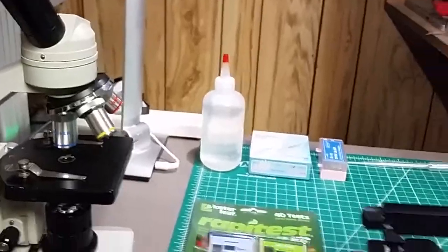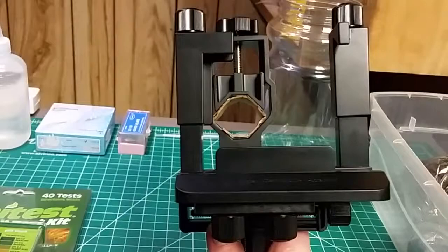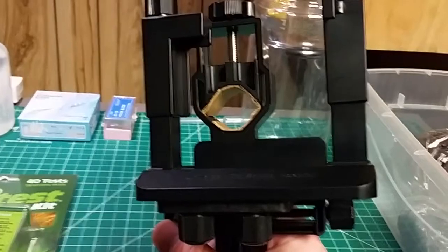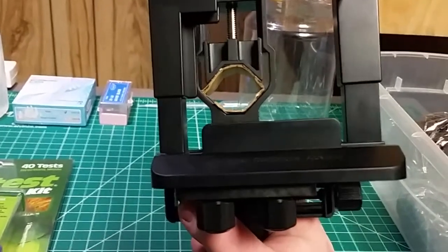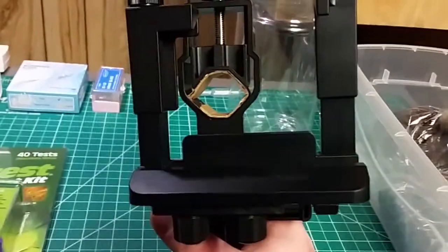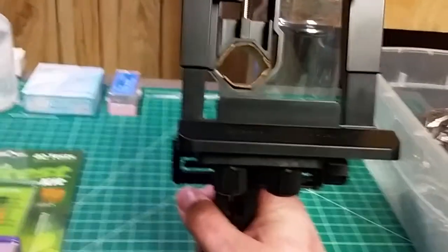As far as the camera mount, this is an Orion SteadyPix Pro. I was shopping around for an eyepiece camera insert for the microscope — they start around $40–50 and are very low quality at that price range. I've got a nice 1080p camcorder in my pocket every day, so this came up for about $45. I purchased one in a damaged box instead of brand new with no problems. It just mounts onto the eyepiece — I did have to add a cardboard shim because my eyepiece is a little bit narrow — and it has quarter-20 mounts everywhere. This is how we're taking our photos and video through the scope.